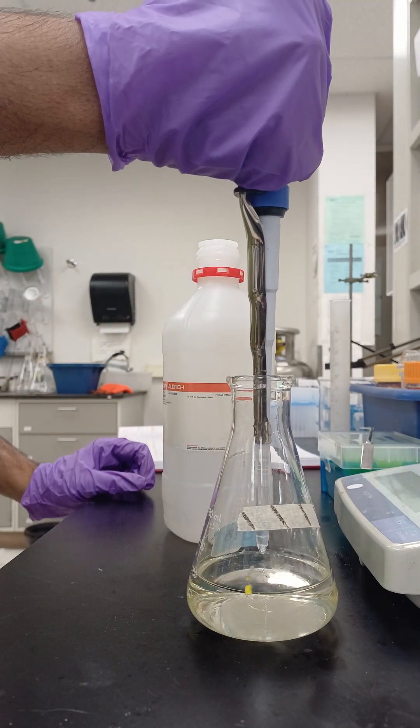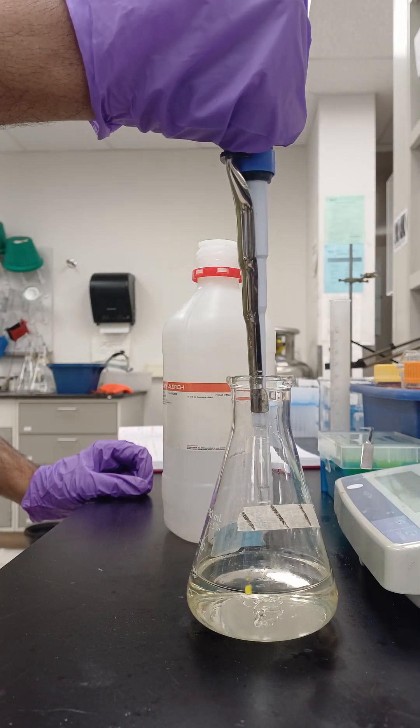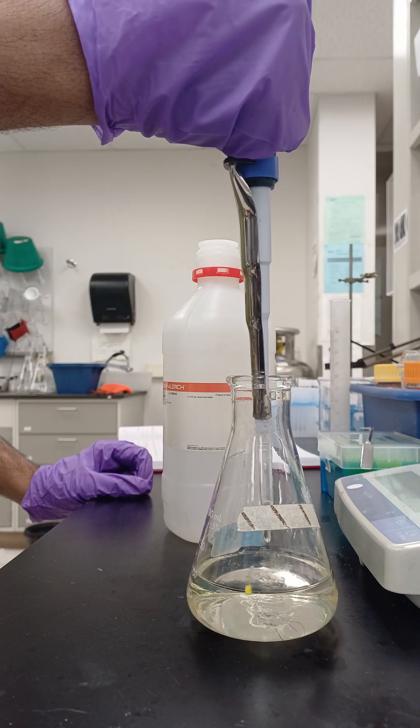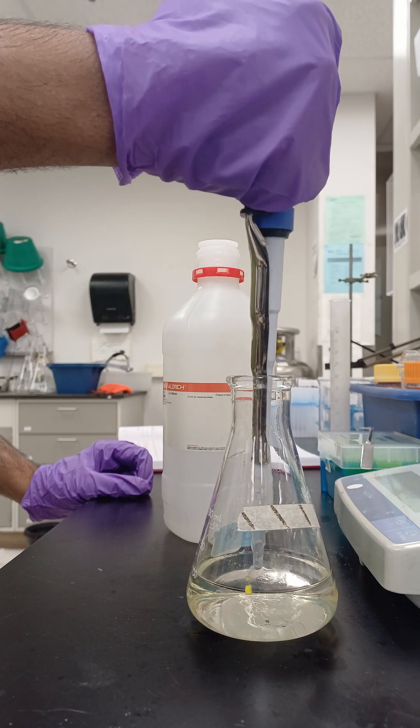Next, I add a small amount of glycerol which acts as the energy and carbon source and also helps in protecting the integrity of the mycobacterial cell wall.